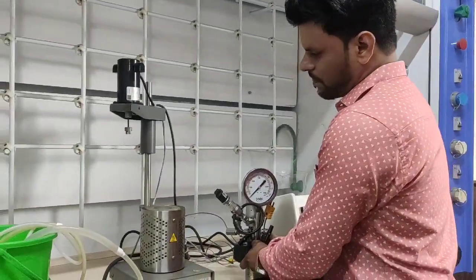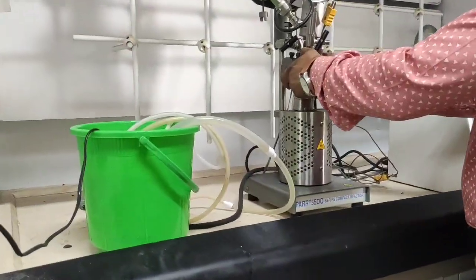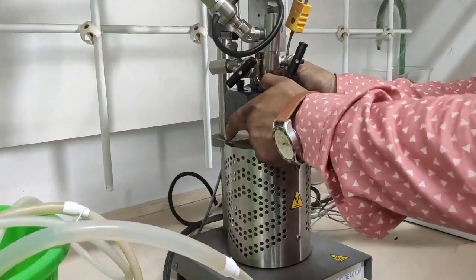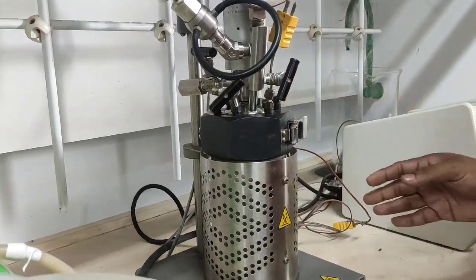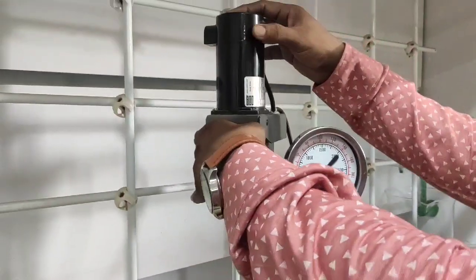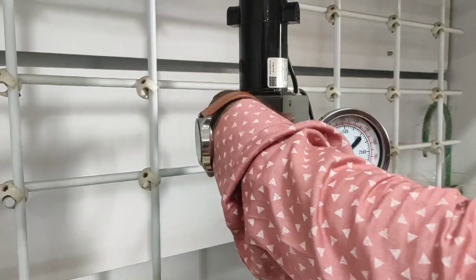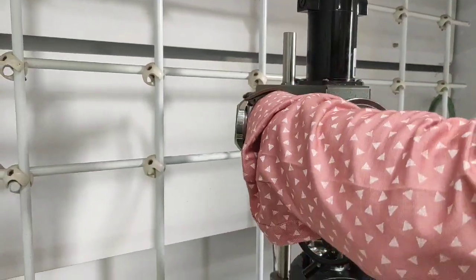And if I clip it here, the system will now become completely closed. So I need to only close the system. I will show you how it actually works.